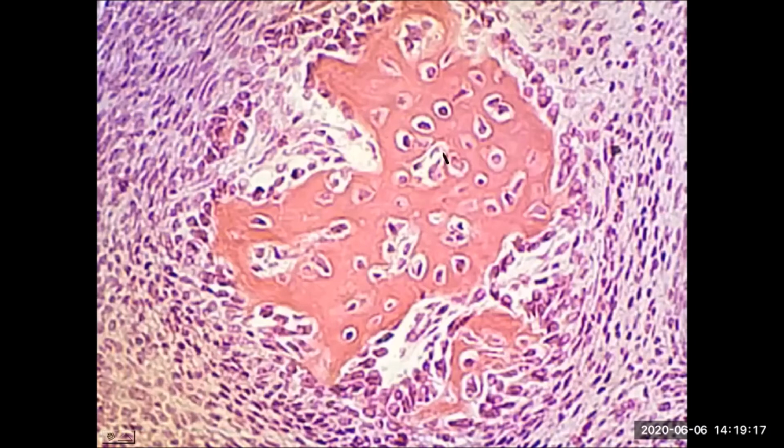And again, anywhere you see trabeculae, the osteocytes are deep in the center. The osteocytes are the mature cells that have already surrounded themselves in matrix, so they're embedded in the trabecula. And the cells right along the border, once again, osteoblasts. If this was still a living sample, osteoblasts would produce more bone, and that would extend the size of the trabecula. And once that happens, these osteoblasts, surrounded in matrix, would mature to become osteocytes themselves.